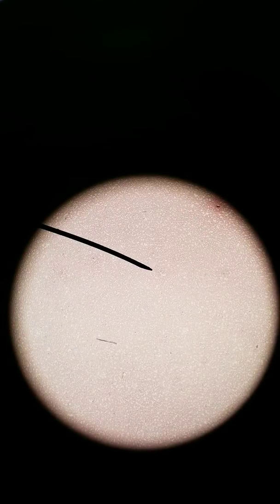Another example of a connective tissue, this one is called connective tissue proper, that areolar one. But we can have solid connective tissue like bones. Bones are a connective tissue. Blood is also a connective tissue. So here's blood at 40x scanning magnification.